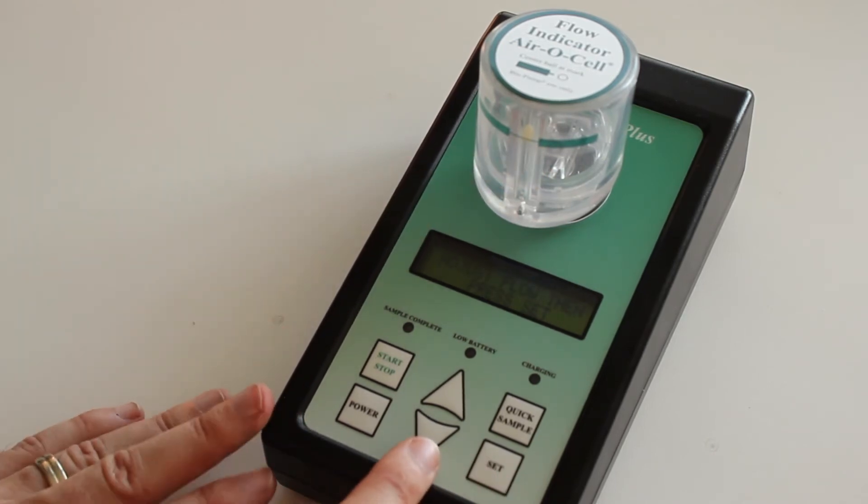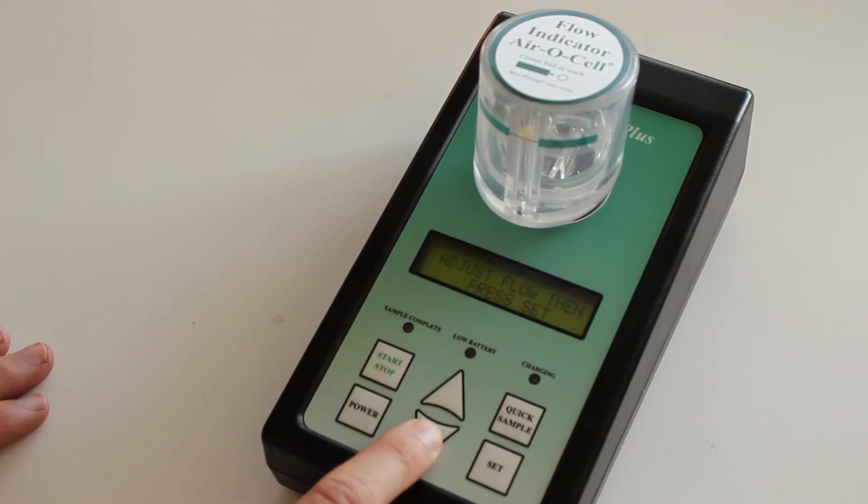If it's not or it's not stable, then you can press down or up depending on if it's above or below the line. It'll slow the pump down or speed it up.